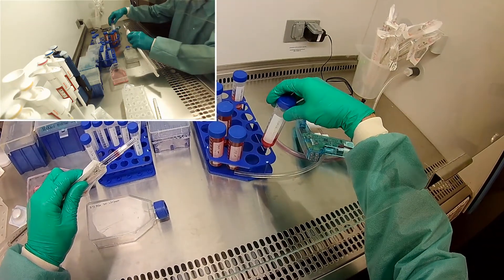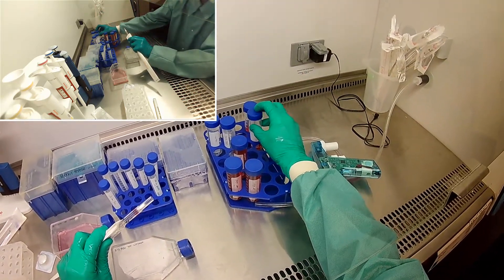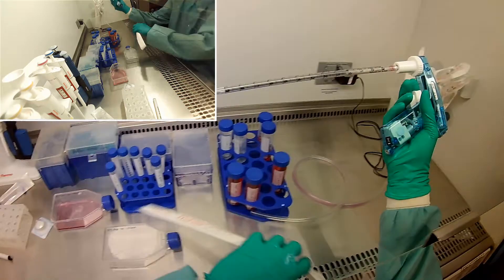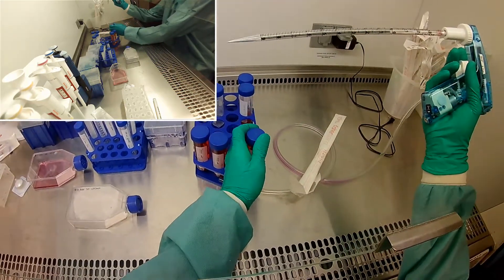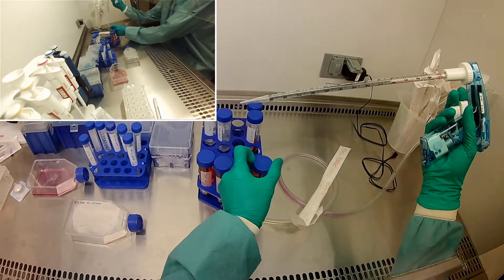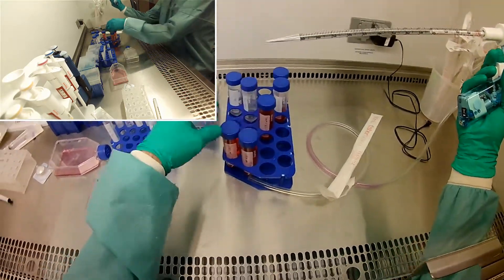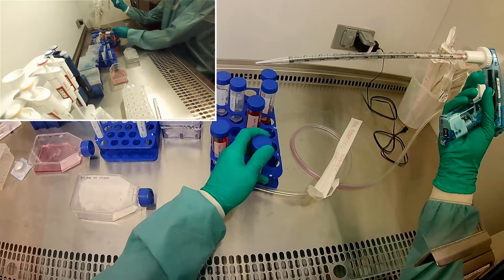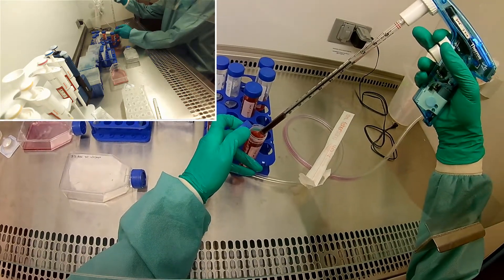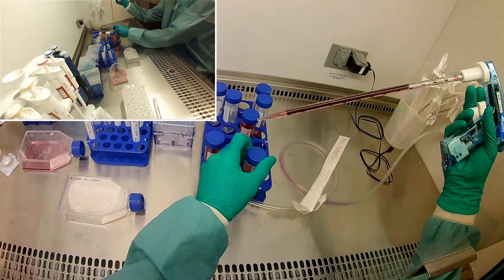So now we're going to resuspend these cells in the 2% low serum media, because this is what we're going to feed our 96-well plate with. I'm going to resuspend them in 10 mils. Okay, so that's bad — I just knocked that cap off, so I'm not going to use that one. That's okay because I have another one out and ready. I'm going to resuspend in 10 mils of my low serum media. Sometimes you catch yourself. This is why it's also good to have lab partners around — they help catch your mistakes as well.